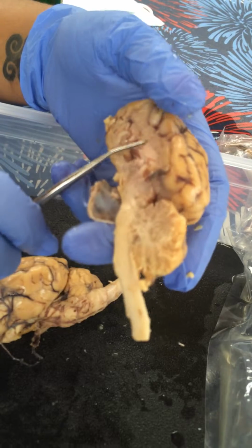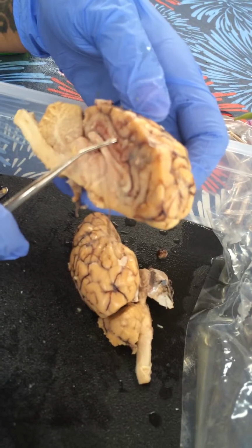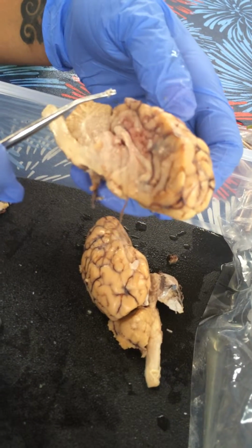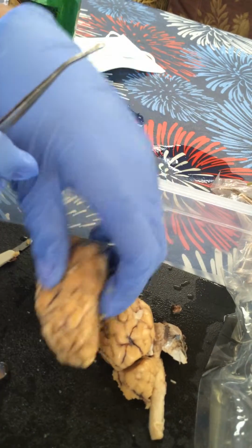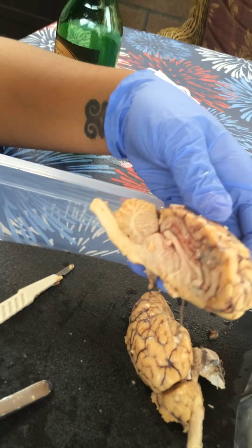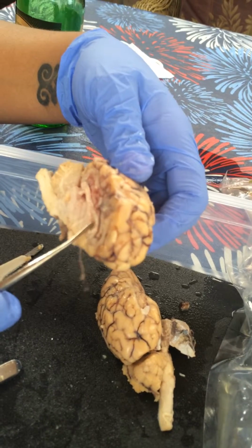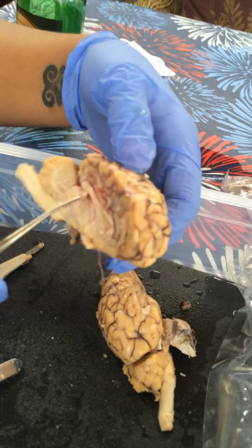It's actually the top of the actual, let's see if it looks better on this side. So it would be the top of the ridge right here. And the fornix would be the bottom of the loop here. Can you flip my page for me? Okay. So the lateral ventricle would be the center here. There's like a little covering over it. If I take it off, you can see the lateral ventricle.